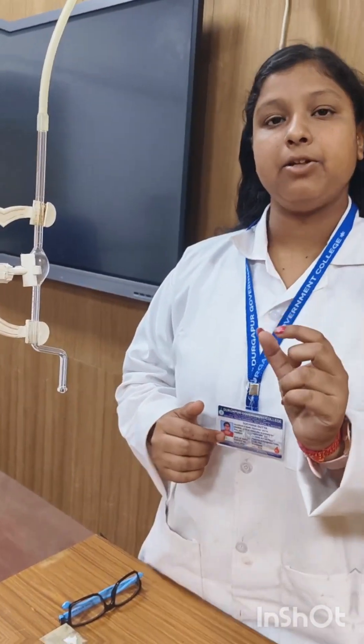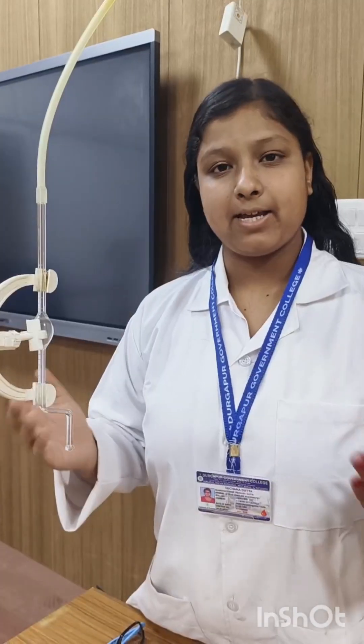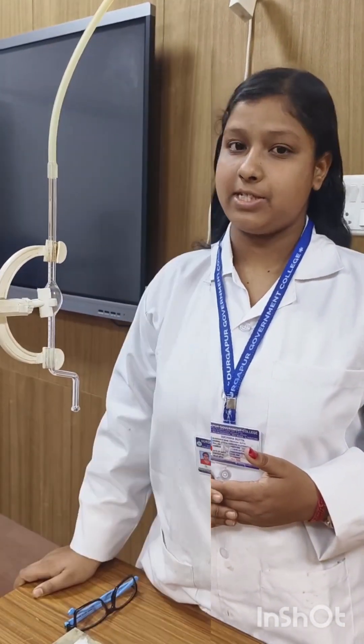The weight of each drop depends on the liquid's surface tension. By comparing the number of drops for different liquids, or even the same liquid, we can calculate and compare their surface tension.